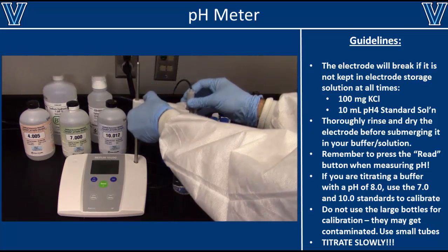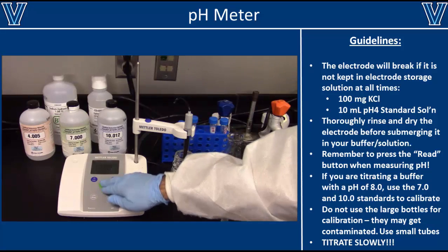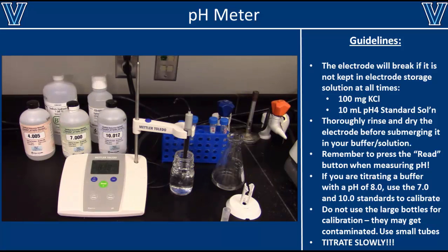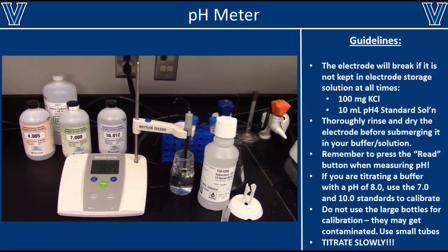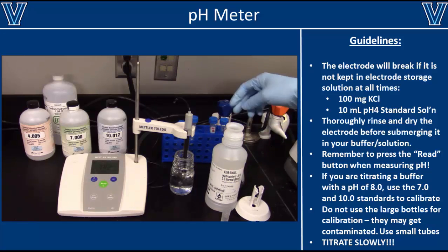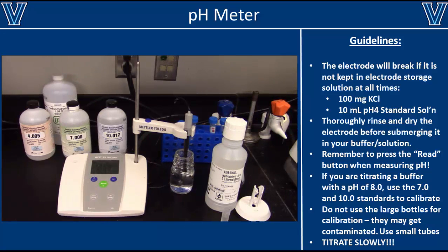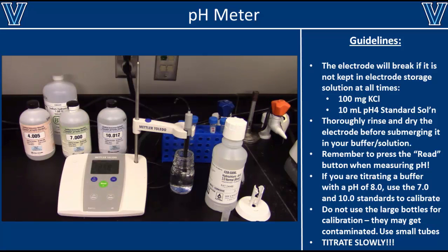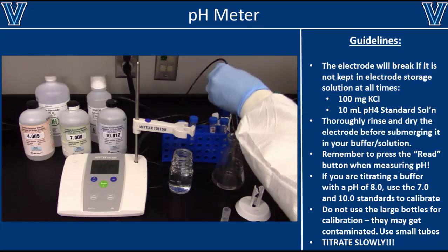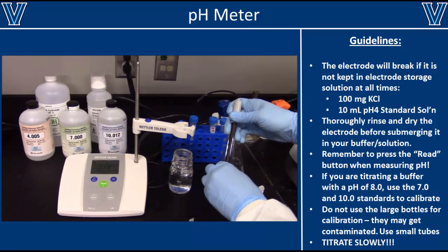To measure pH, completely submerge the tip of the electrode into your solution and ensure that it is vigorously mixed. The best way to do this is to use a stir bar and a stir plate, but you can do it with your hand if those are unavailable. Remember to press the read button on the pH meter and give it a little while to stabilize. Once the reading has stabilized, you can adjust the pH of the solution with hydrochloric acid or sodium hydroxide. Note that hydrochloric acid will decrease the pH while sodium hydroxide will raise the pH. Add the acid or base in small amounts and vigorously mix the solution after you add them. Once you are done titrating your solution, remember to put the electrode back into the storage solution.